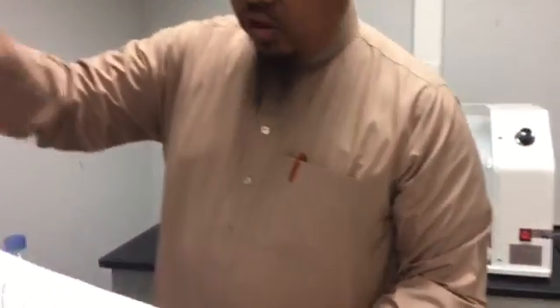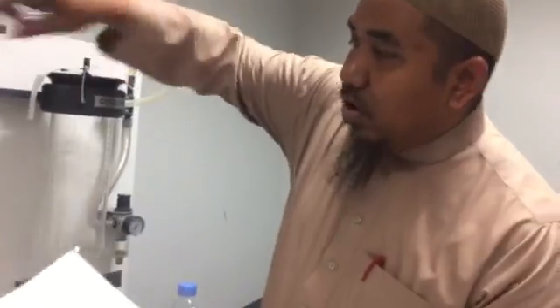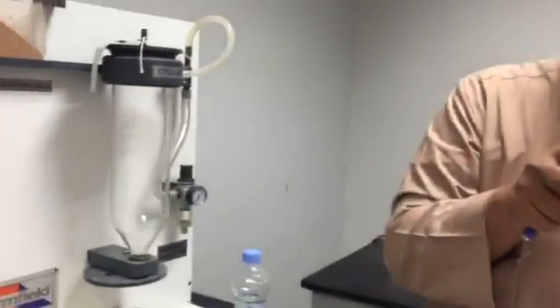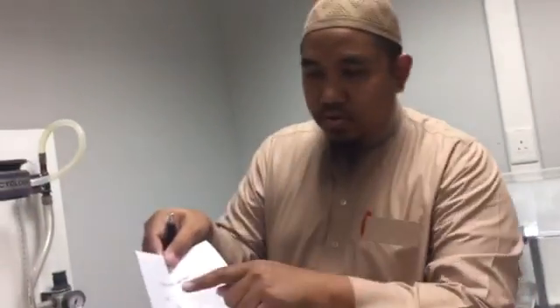Before you change to another size, with this same size, you make it a little bit wet. Spray just water, so you make it a little bit wet, but not too wet. Don't put too much water, it will stick. Now it is dry, make it a little bit wet, and then do the same again.